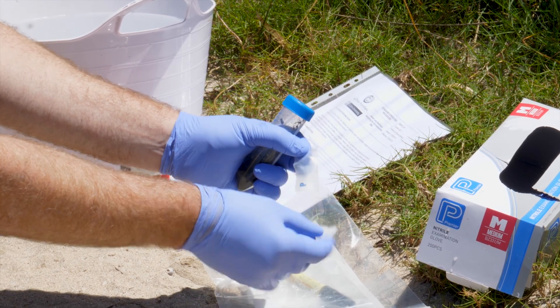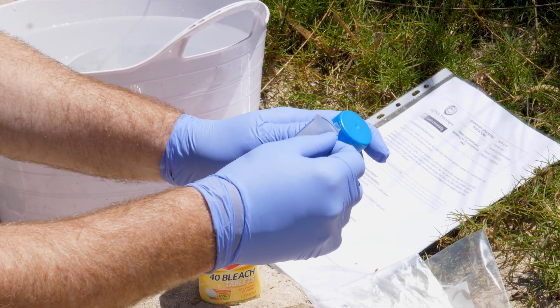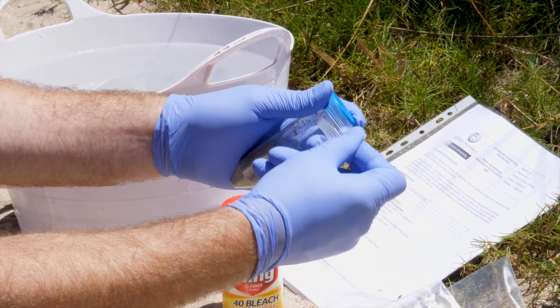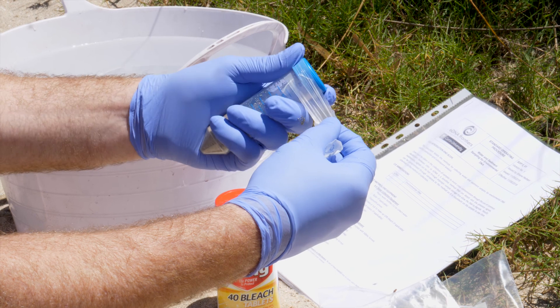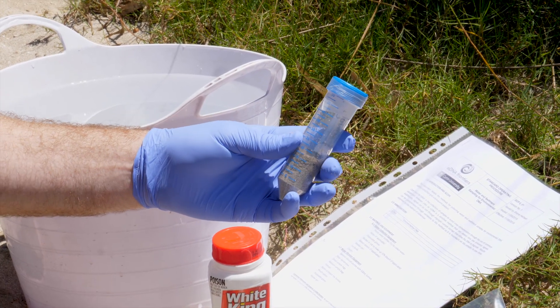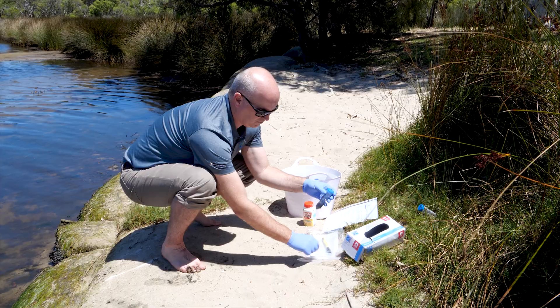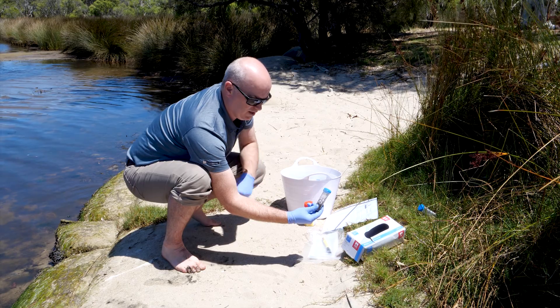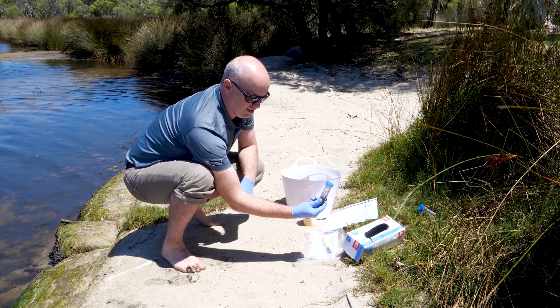Once you take the backing paper off the parafilm, hold one end of the plastic to the tube with a finger and then pull the other end as you stretch and wrap the film around the tube. This may run around the tube thread a few times, and then you can simply hold it onto the film to get it to stick to itself. Now your sediment sample is ready to be cooled or frozen before being transported to the analysis lab.